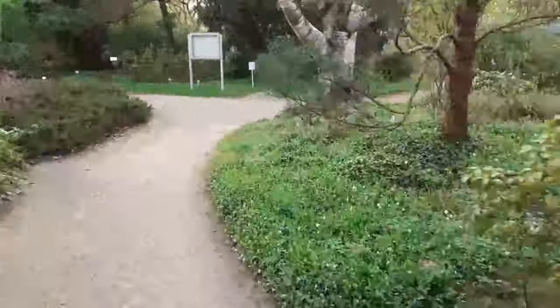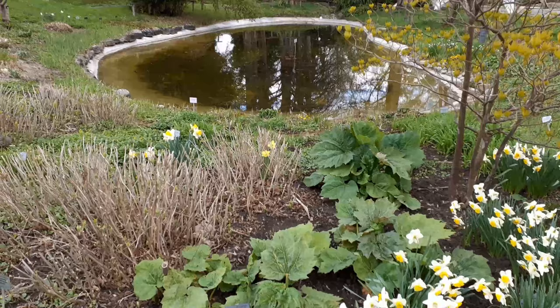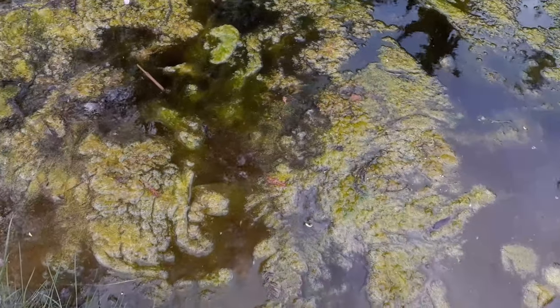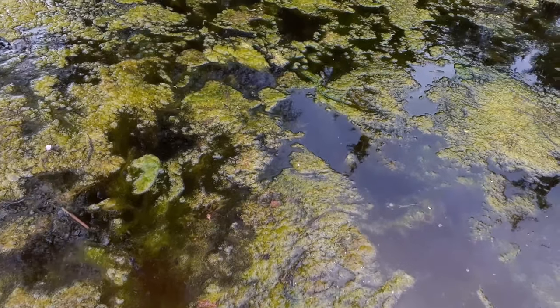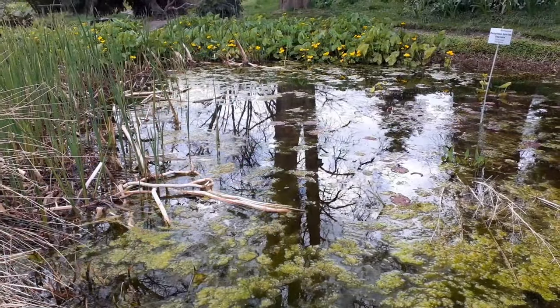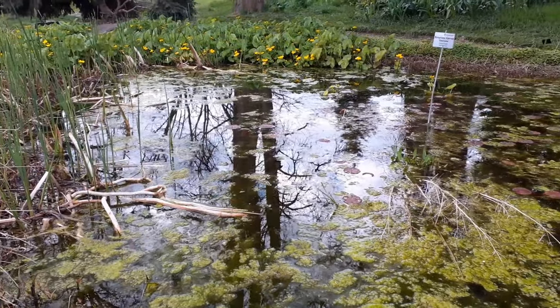This pond over here isn't really accessible either — I'd have to step over newly planted flowers. But look at this pond: a lot of green stuff on the water, algae and probably a lot of diatoms. I was here last year and there were water fleas and water crustaceans too, so I'm going to take a sample today.